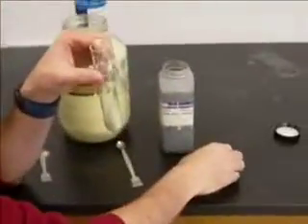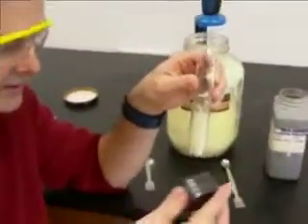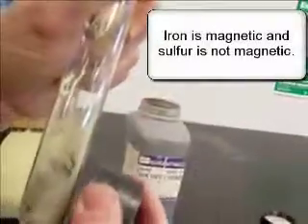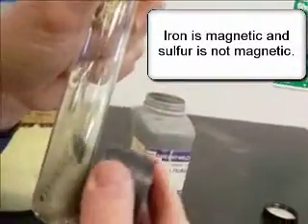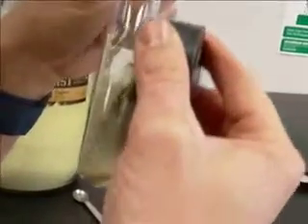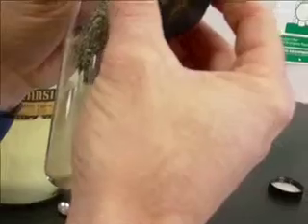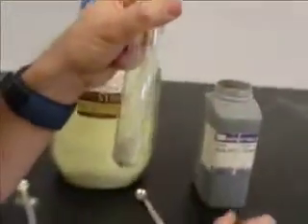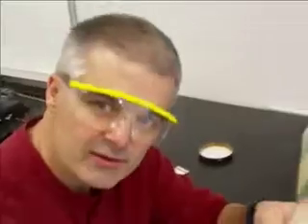Now one way I can know that is I happen to have a magnet right here, and if I take the magnet, I don't know if you can see this, I can move the iron. Iron is attracted to the magnet. So I can do that. The sulfur stays at the bottom, because the sulfur is not attracted to the magnet, but the iron is. So now this is essentially just a mixture of iron and sulfur. So they have not reacted.